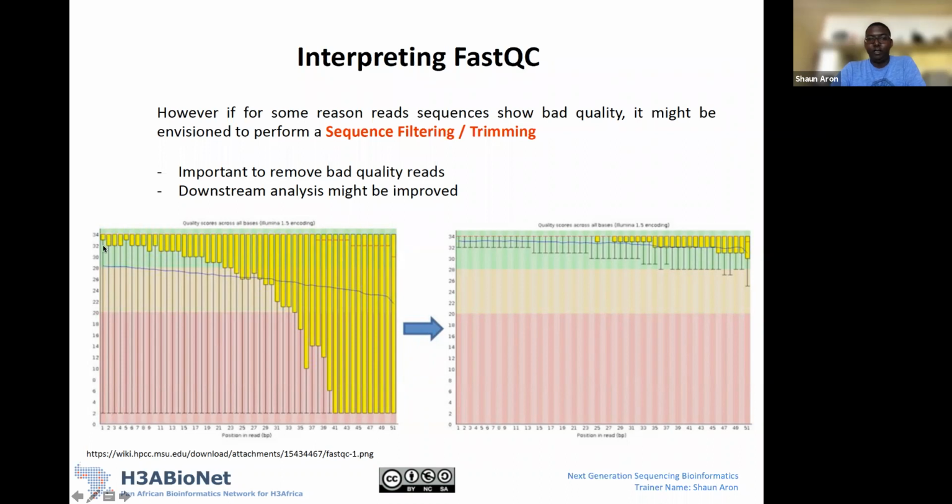But what you'll see is that for the first part of the reads, the majority are all above 30 up until about position 25. Then it starts to drop to 20 around here. And we've got these long tails here. So we have samples in between that are dropping all the way to 2.